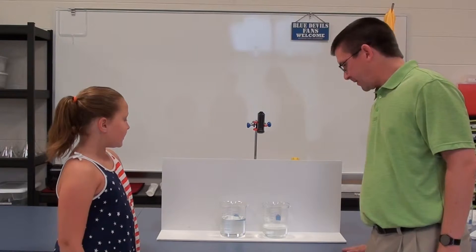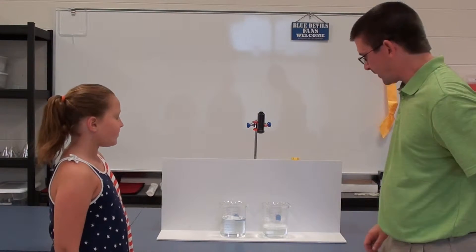All right, Lindley, today we're going to be looking at acids and bases and how they work with indicator solutions.